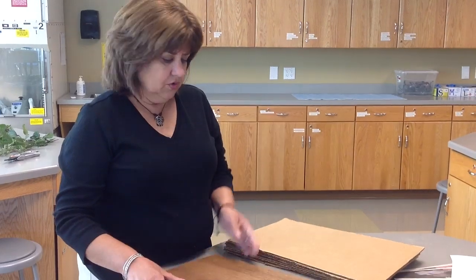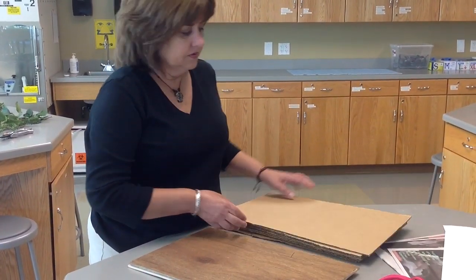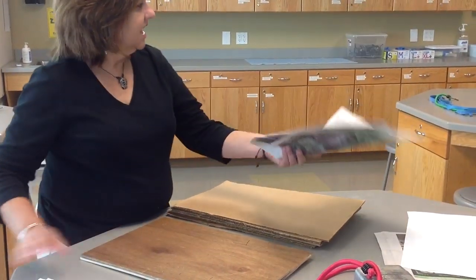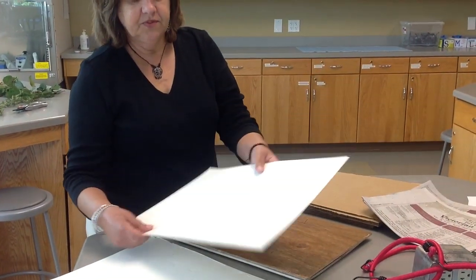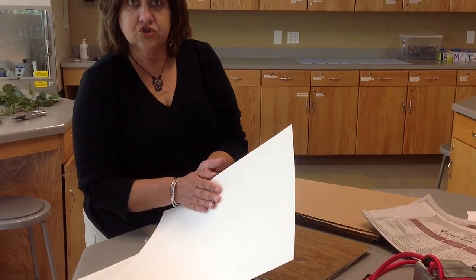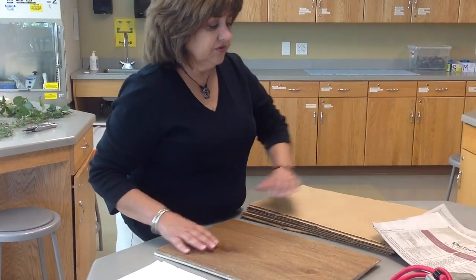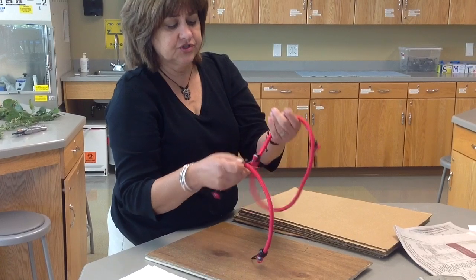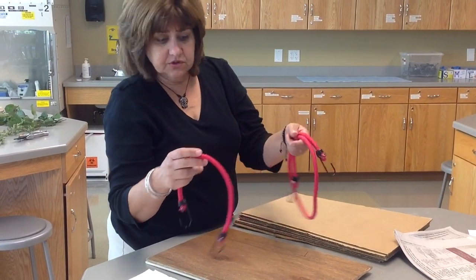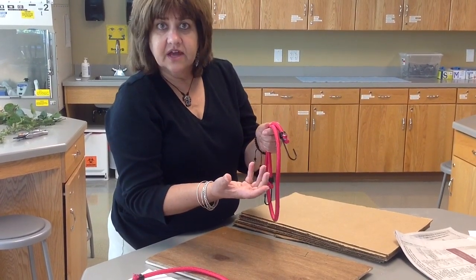You're going to have two outer wooden boards, cardboard, newspaper, and felt paper. This felt paper is for absorbing moisture. And then you're going to have some sort of cords, rubber bands, or materials to hold the whole thing together.